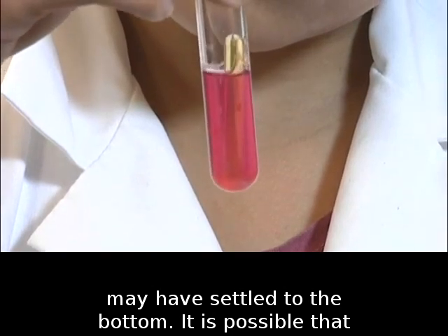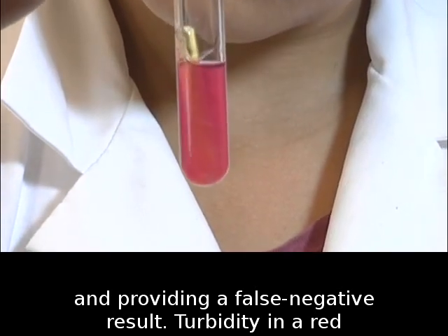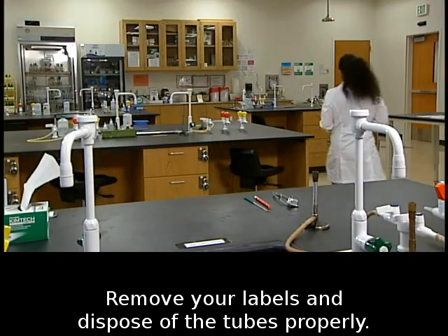It is possible that the culture did not grow, leaving the tube red, and providing a false negative result. Turbidity in a red tube, however, confirms a true negative result. Remove your labels and dispose of the tubes properly.